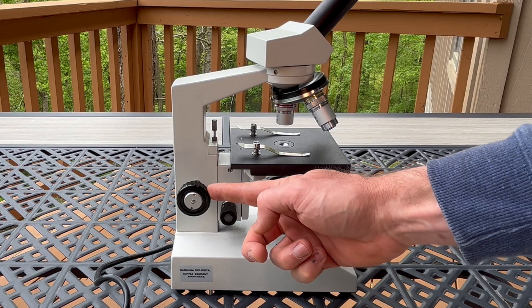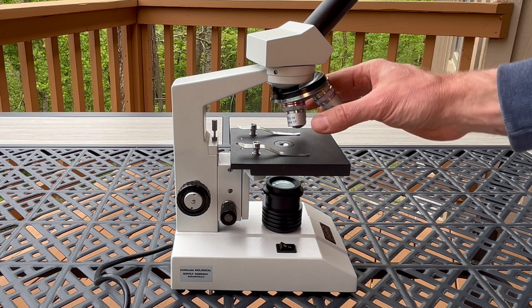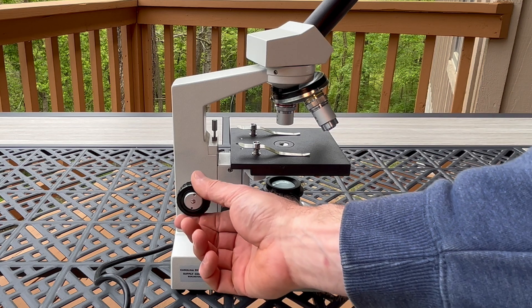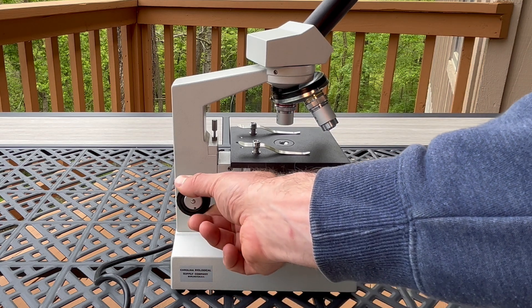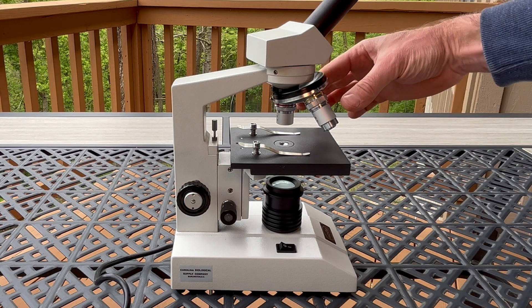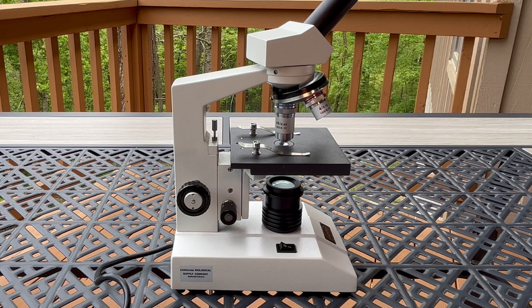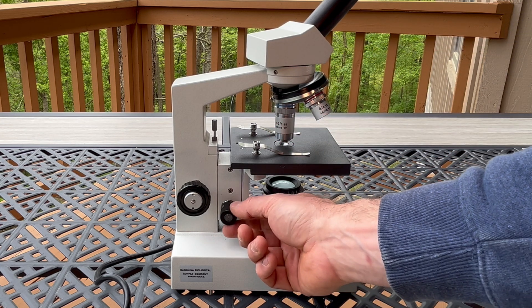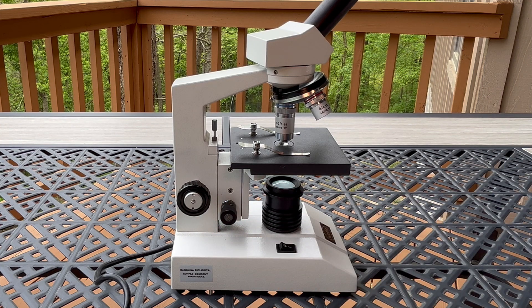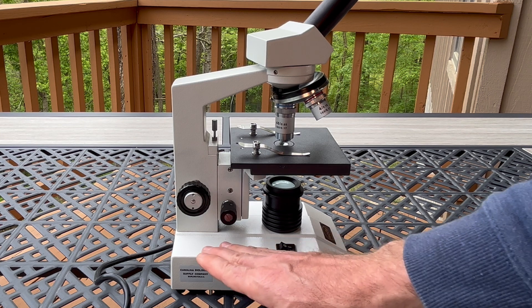These knobs are the coarse and fine adjustment knobs. When using the lowest magnification objective lens, you will use the coarse adjustment knob to get your specimen in focus. Once you have it in focus and switch to your medium or highest objective lens, you will then use the fine adjustment knob to bring the specimen into focus. The bottom of the microscope is called the base.